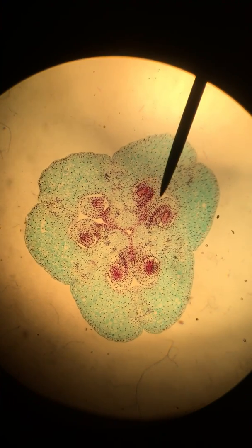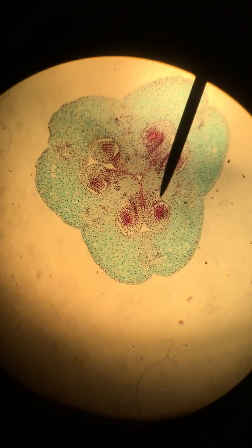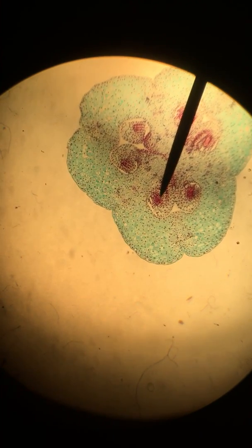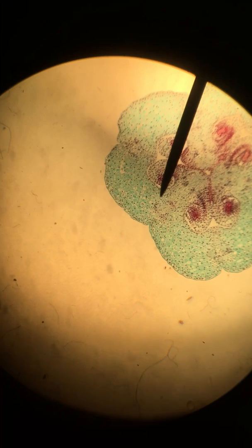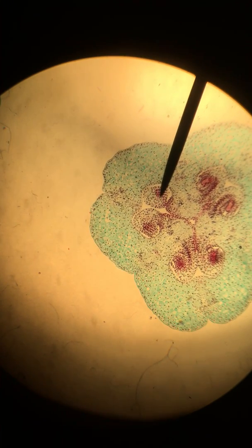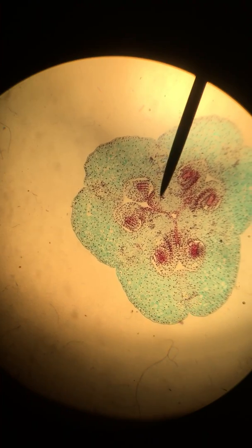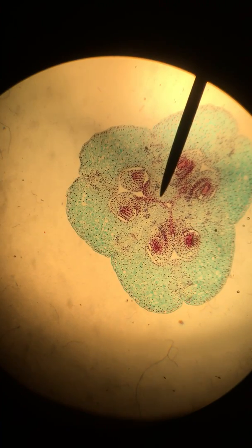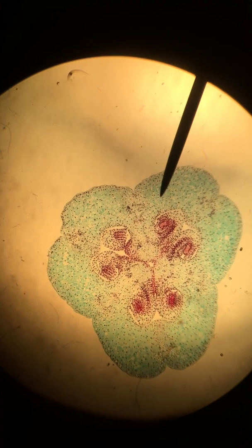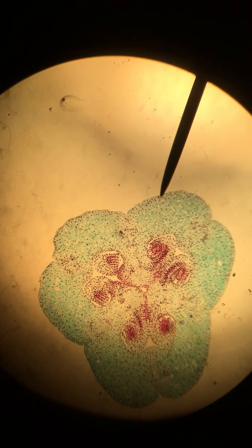Here is one ovule, here is another, a third, a fourth, a fifth, and a sixth. So these ovules attach at the placenta, which is at the very center of the ovary. Of course this is the ovary wall on the outside.